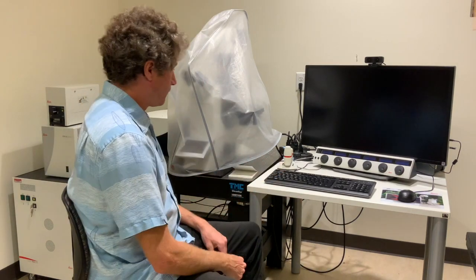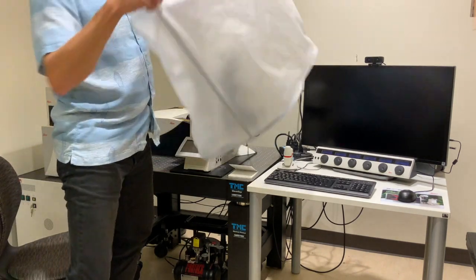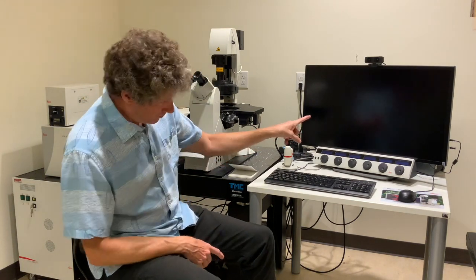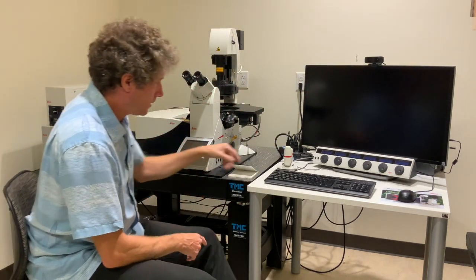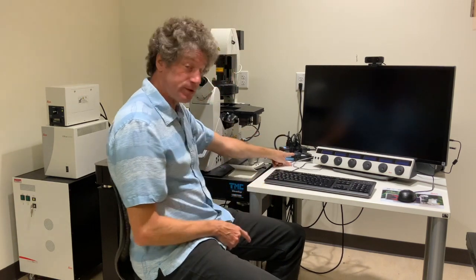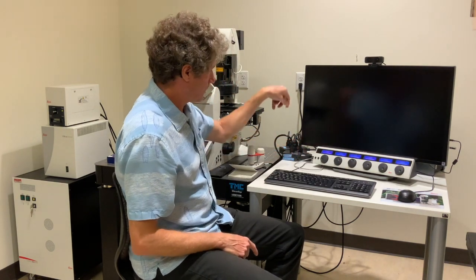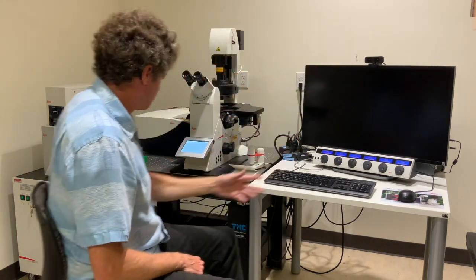This is a brief startup tutorial for the Leica SP8 Confocal. First thing you do is take off the cover carefully and put it over there. Next, we need the computer on. The computer is behind here, and we need the microscope on. That is all in these power strips — there's a power strip here and a power strip back there. You click them all on: the computer, and then the very back one.